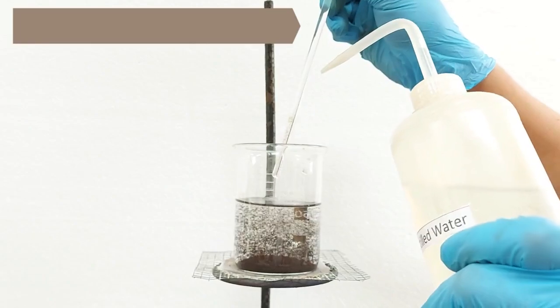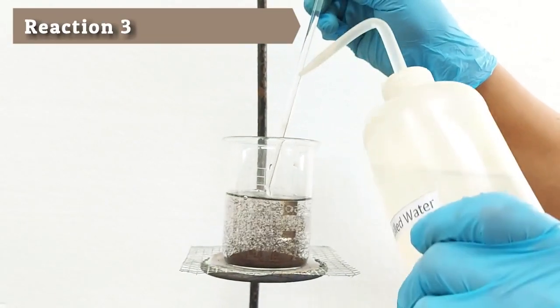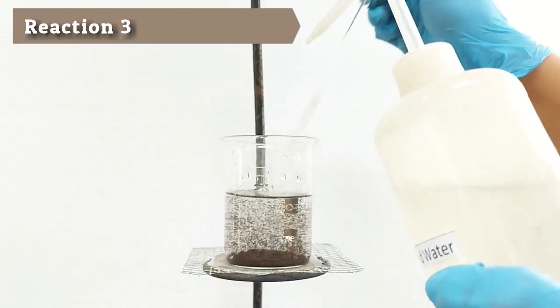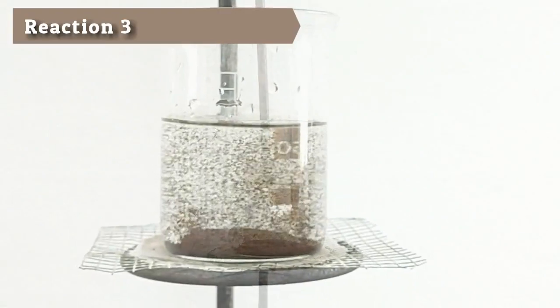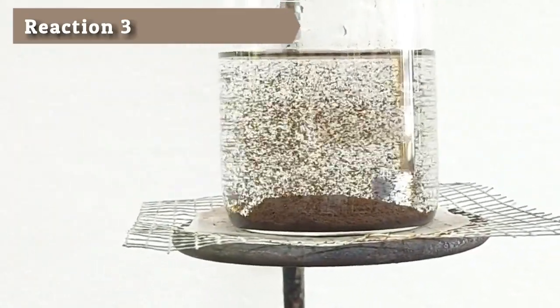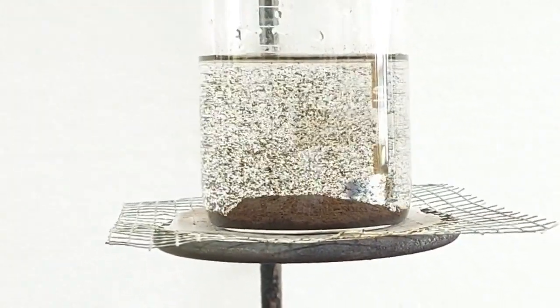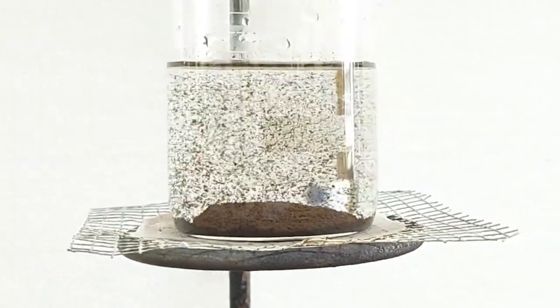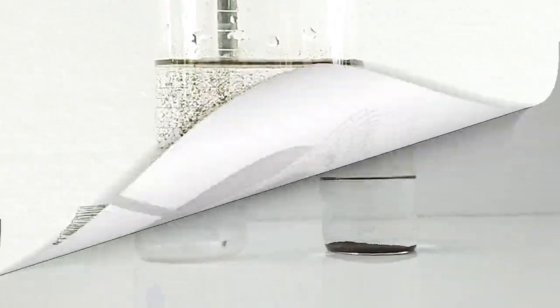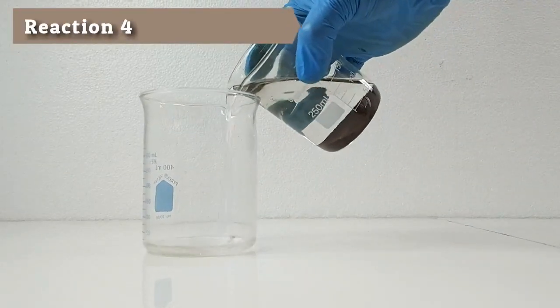Rinse off the stirring rod into the beaker with a small amount of distilled water to remove the adhered precipitate. Decant the supernatant liquid carefully.